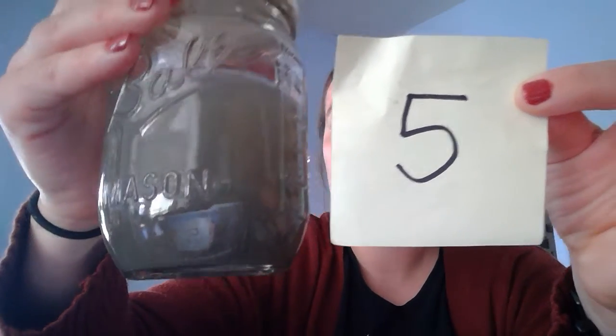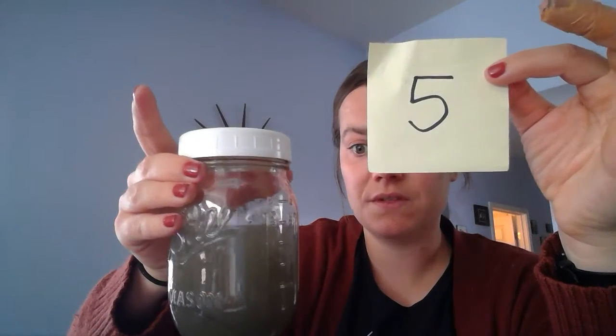But also lots of just dissolved chunks that make this super cloudy. So as we talk about water, an important vocab word that we will use often is this idea of turbidity. Turbidity is just how cloudy or how clear a water sample is. So this is very turbid. You cannot see through it.